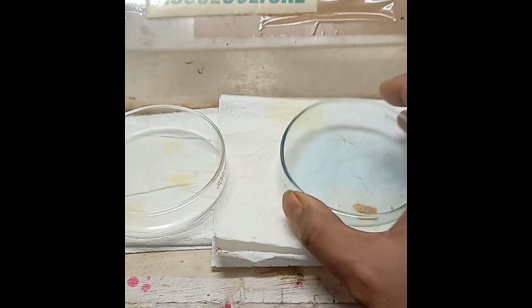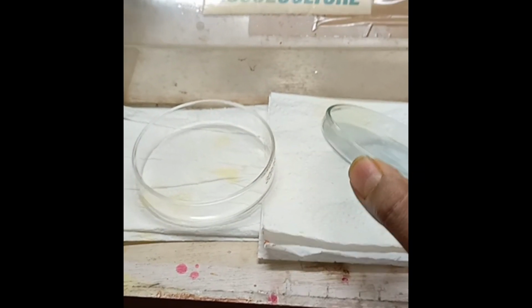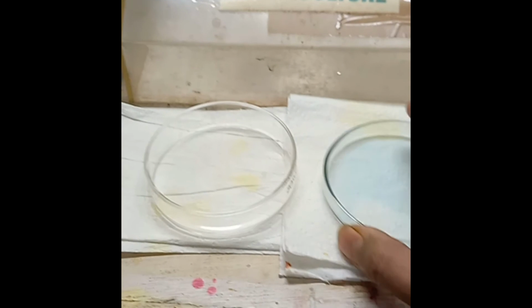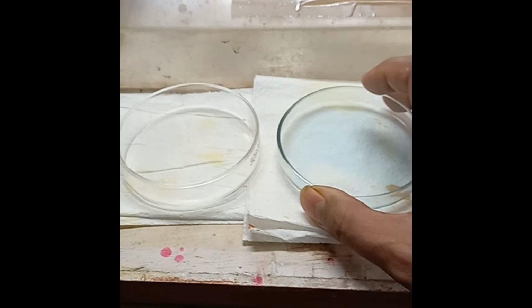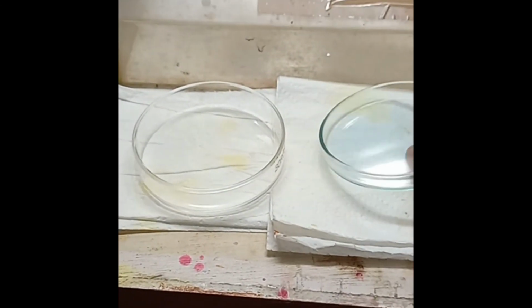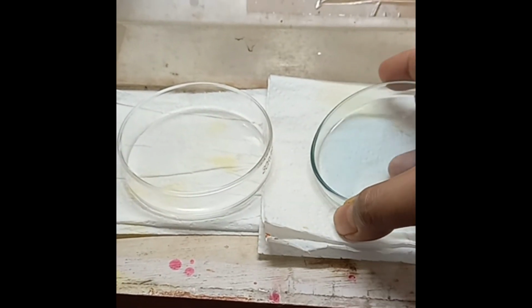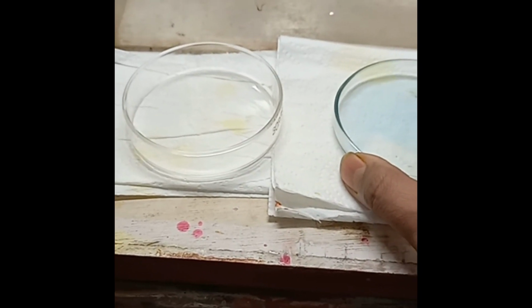If you use a very sleek petri dish like this with a low edge, then you will have a very correct vision under the TCM microscope. It will be very easy to see, because the TCM 400 microscope actually sees from the bottom, and the light falls from the top. You will place your sample on the TCM 400 microscope.